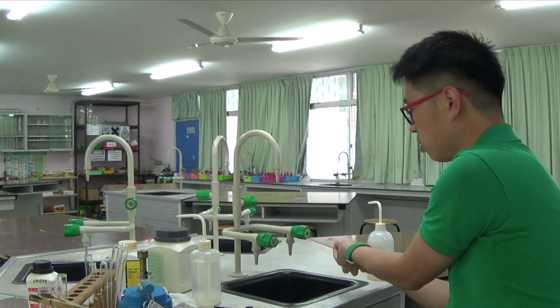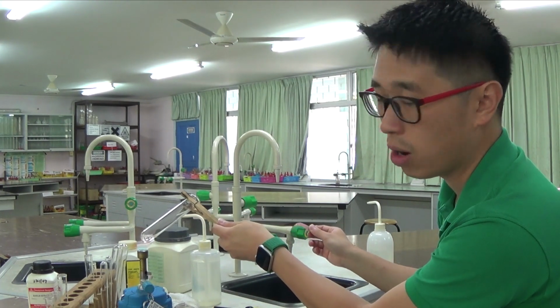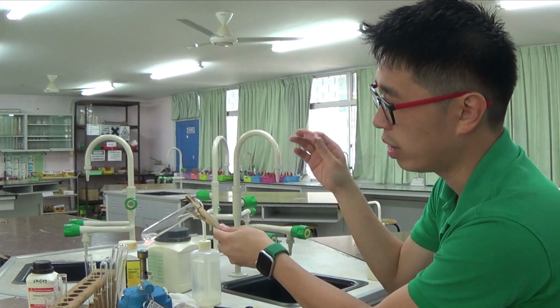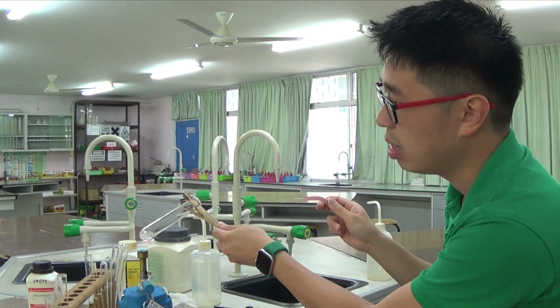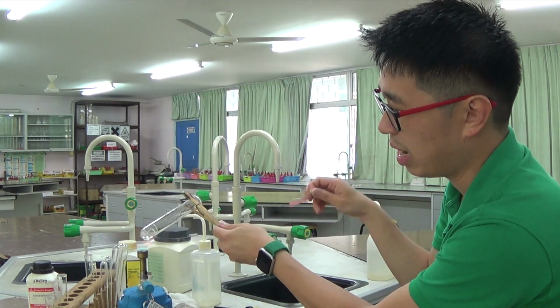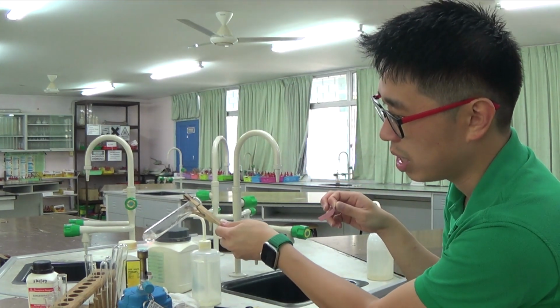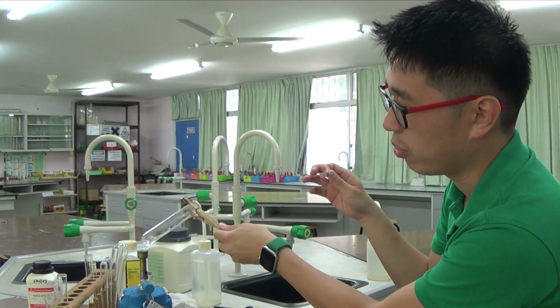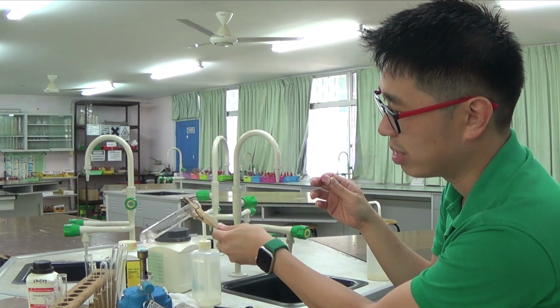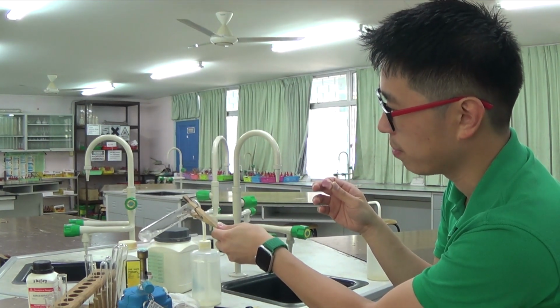So I want to keep on heating it until no more ammonia is given off from the ammonium ion, because I am going to test for nitrate with the same solution. Usually for ammonium ion, it's very simple on its own. You just get the ammonia gas, get the test, and you're done. But this is special because it is asking you to test for the nitrate as well, and making sure that the ammonia from the second test comes from the nitrate, not from the ammonium ion.